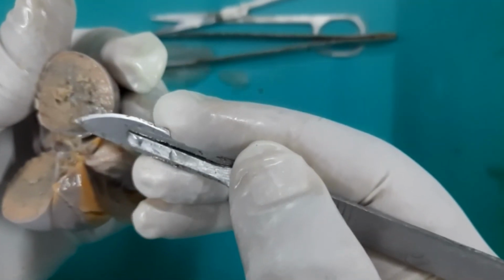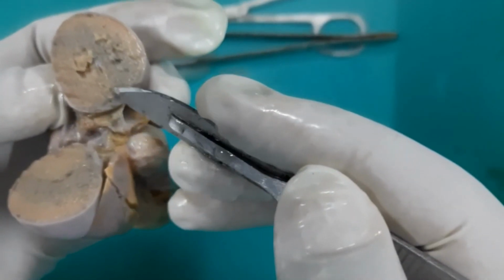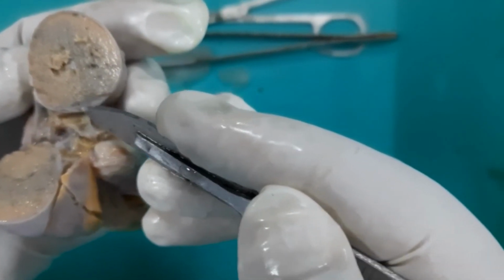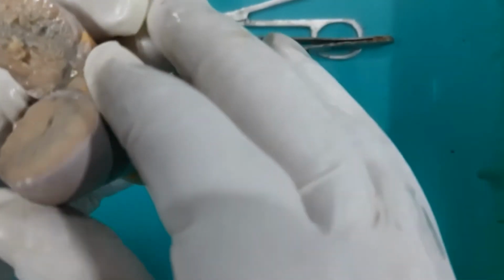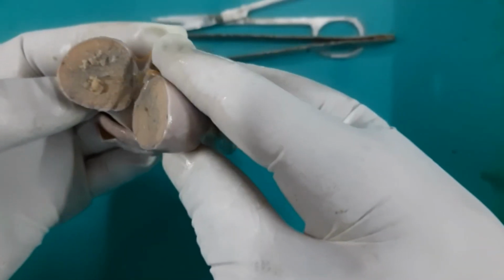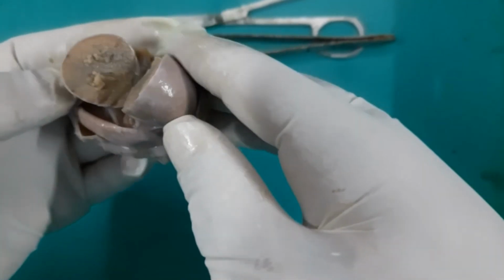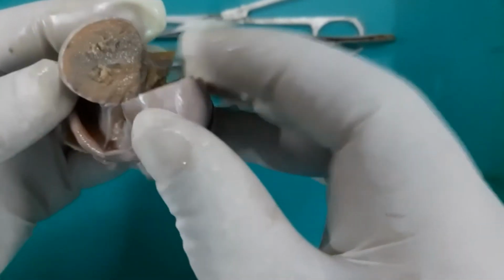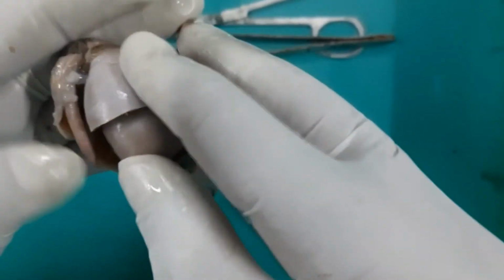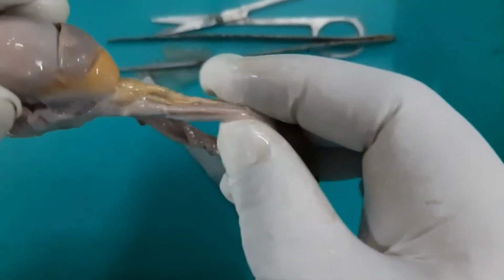Now these seminiferous tubules then open as straight tubules into the mediastinum testis. Then there is the rete testis, and then they form the efferent ductules, which will form the head of the epididymis. Okay, and then in the tail and the body, there will be a single duct which will go out in the spermatic cord as the vas deferens. So this is the testis, dissection of the testis and the spermatic cord.